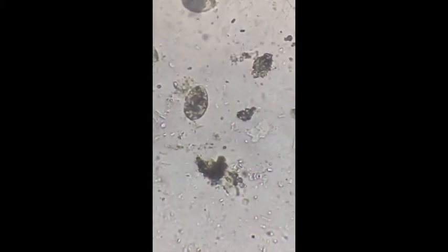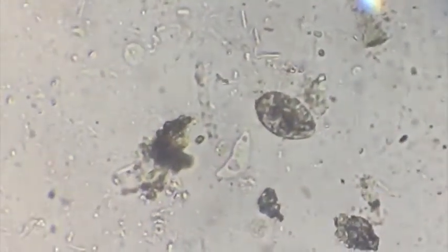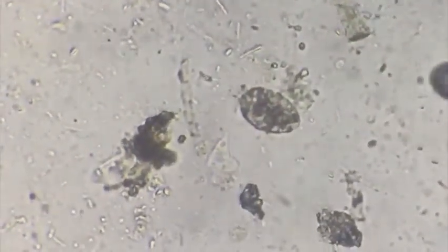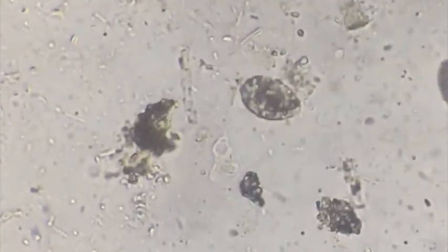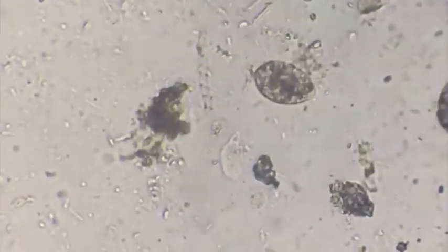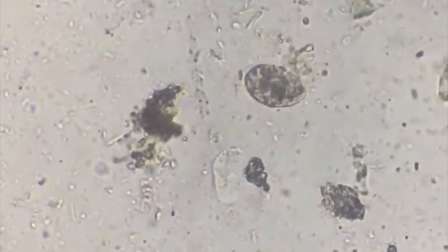You can see the nucleus of the amoeba which is at the center. Now we have a zoomed version of the same amoeba. You can see it has taken a triangular shape and is constantly changing its shape. You can see the nucleus at the center and some vacuoles also. It is putting out its pseudopodium which helps in its locomotion.